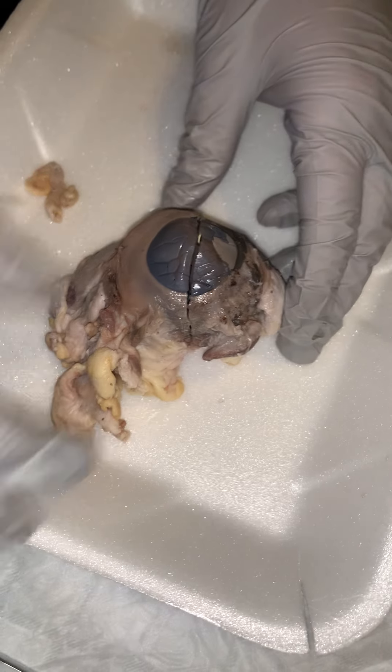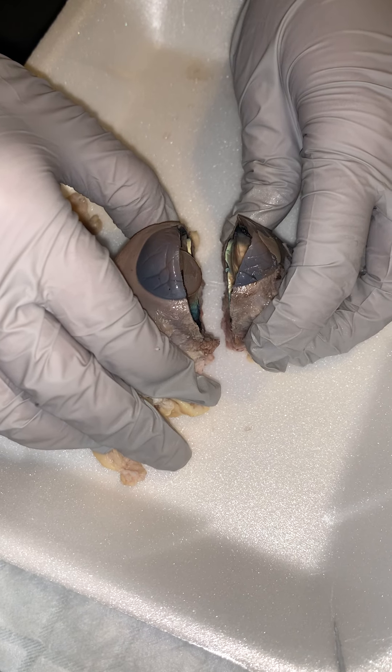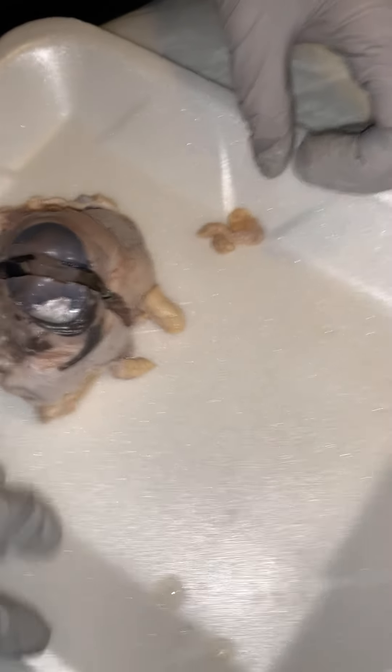Now that we've snipped inside, when I opened this, we did get a lot of liquid coming out. That liquid that flowed out — as you can see over here — that is our aqueous humor, and that comes out of the anterior chamber. Anterior chamber, aqueous humor.